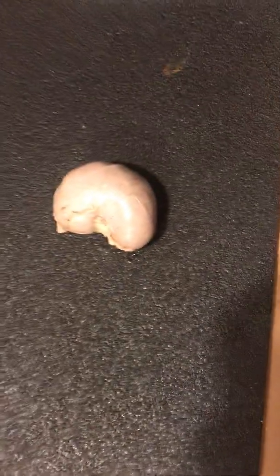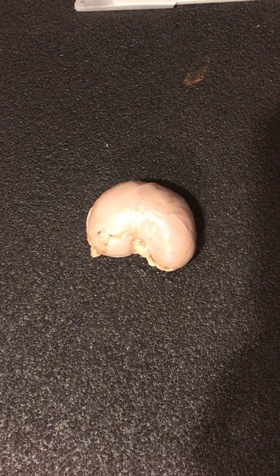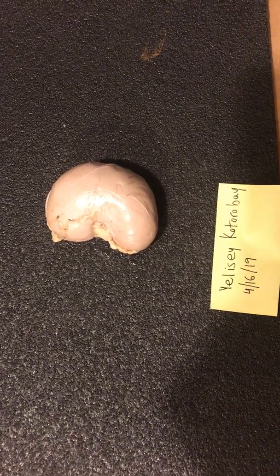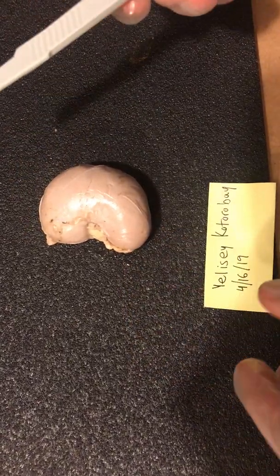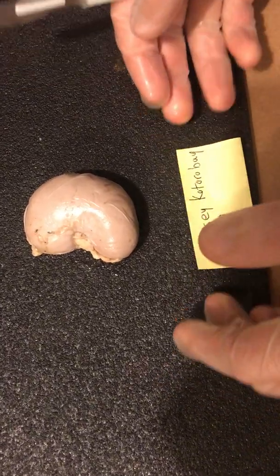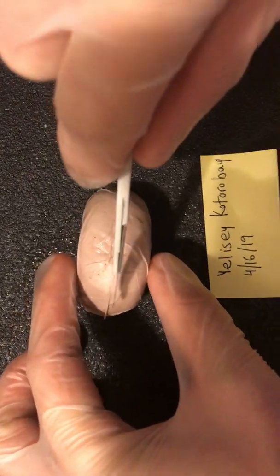If you can just pan over here for a second. This is an exterior view of the sheep's kidney. As you can see, for some reason the folks that prepared it cut the vessels that normally feed to and out of the kidney a little bit short. For the sheep's kidney, the only thing we really need to do is make an incision. It might end up being several incisions, to be honest, but we will make do.